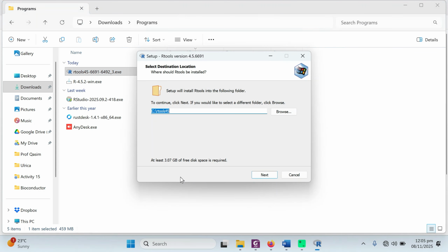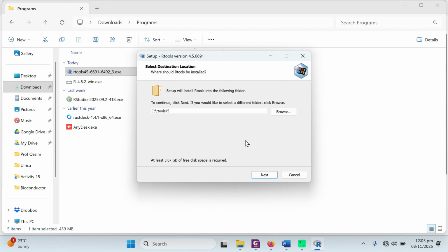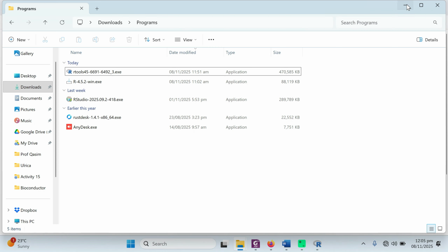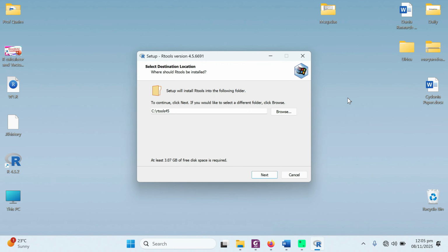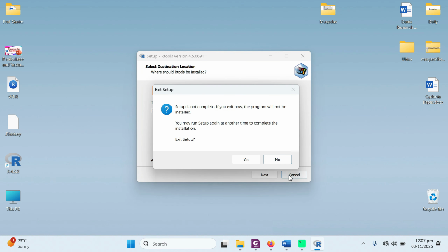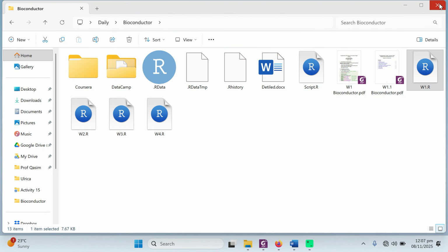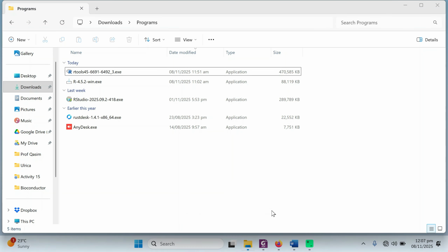Click on the yes button and then click on next. It says already installed, or you can simply install it at another location, or you can choose it by default. As I have already installed RTools, that's why it is asking that you already contain the file. If you don't have it, you just need to click on next and install. It will be completed. After this one is completed, you can simply go for the installation of RStudio.